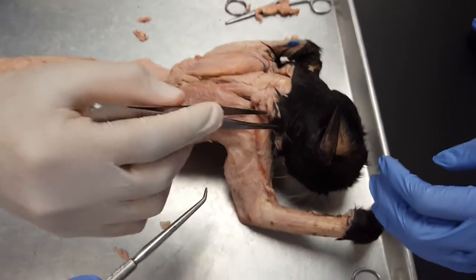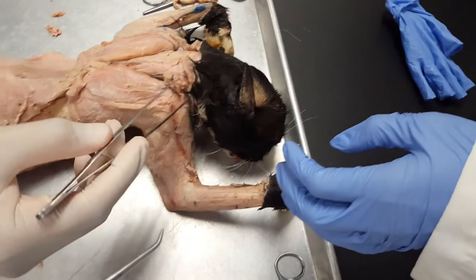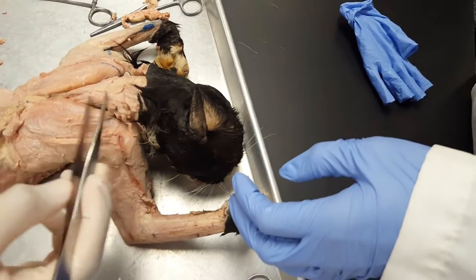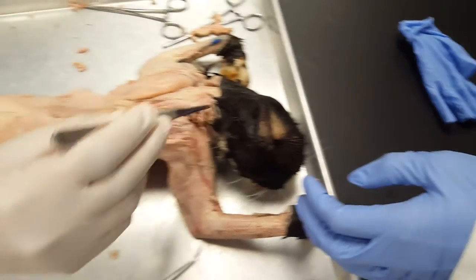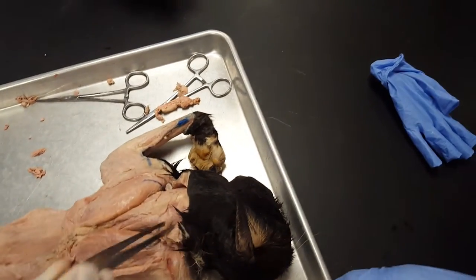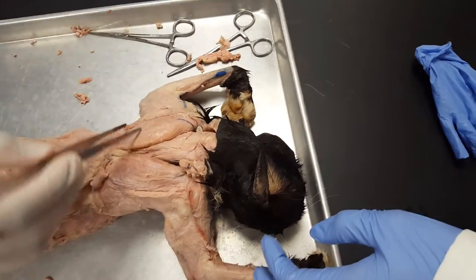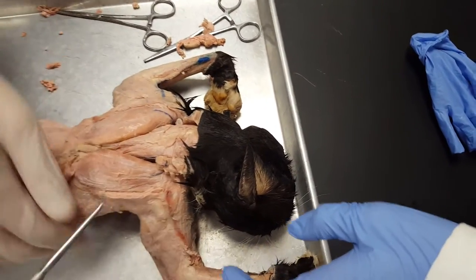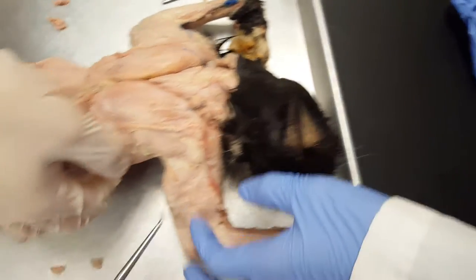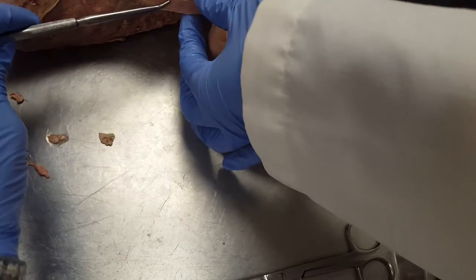You guys cut off the clavotrapezius. She said to know the trapezius group — we don't need other groups. Then we have teres major, right there.